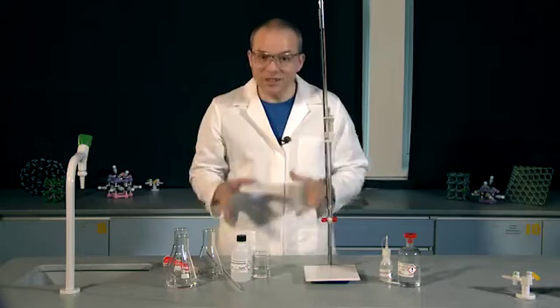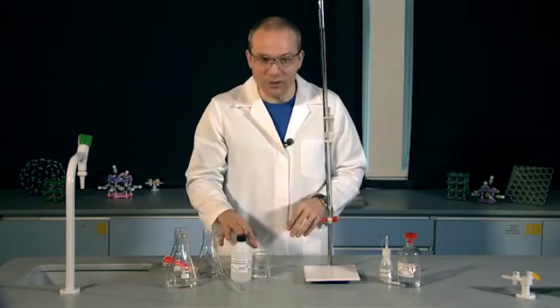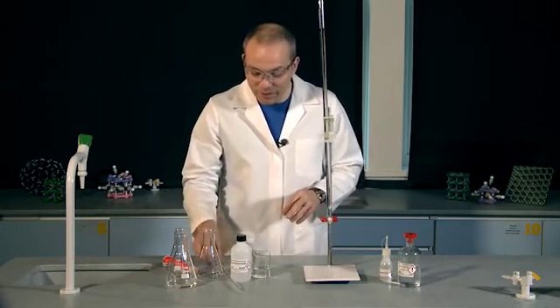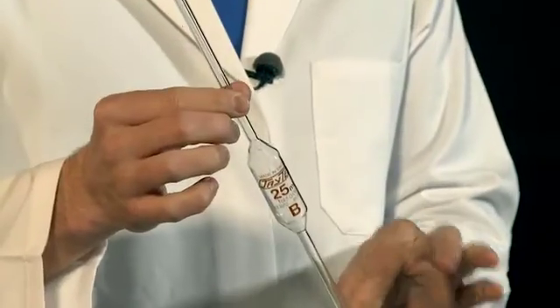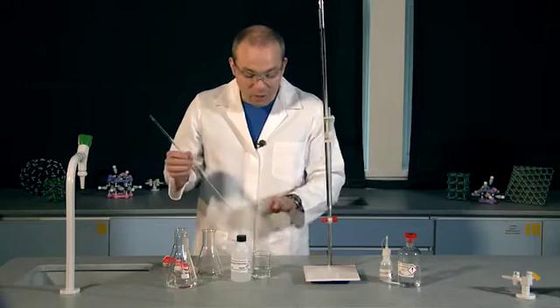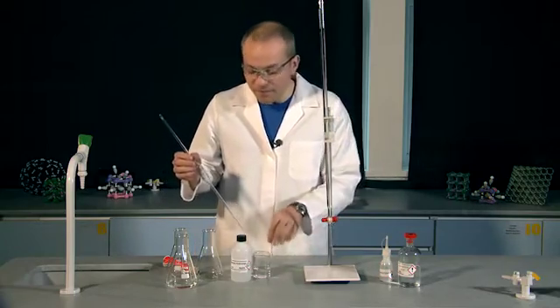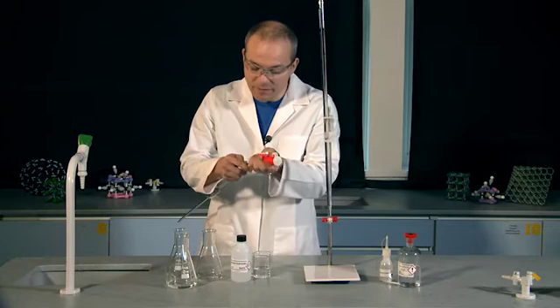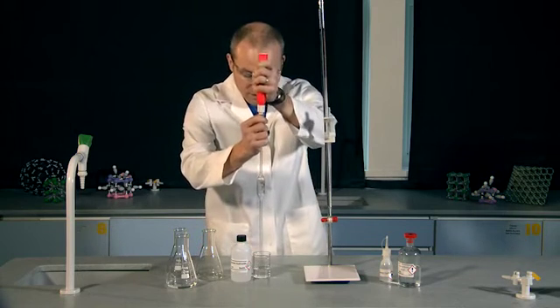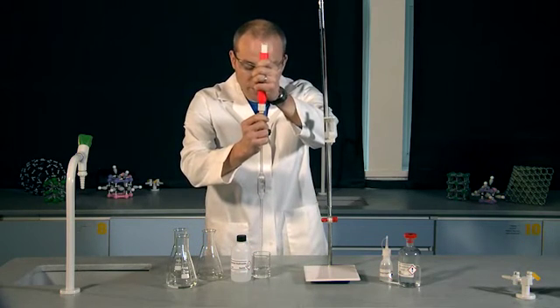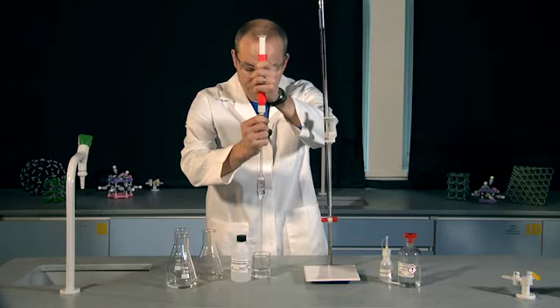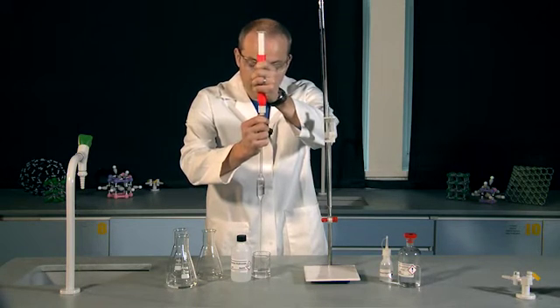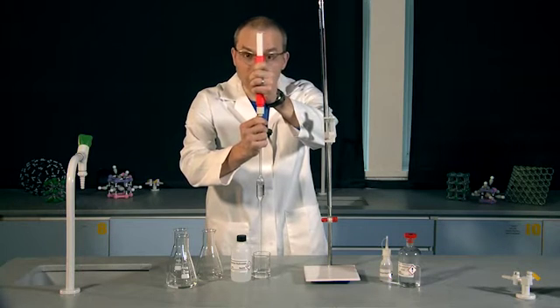The first thing I need to do is measure out my sodium hydroxide solution. To do that, I'm going to use a glass pipette, and this is a very accurate measure of 25 centimetres cubed. I've already got some sodium hydroxide in my beaker, so I'll use my pipette filler and my pipette. I'm going to draw up my sodium hydroxide, and this is going to go into my conical flask.